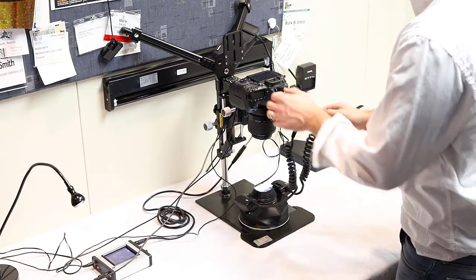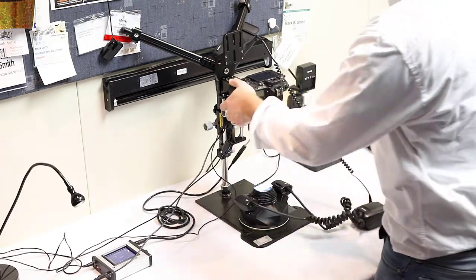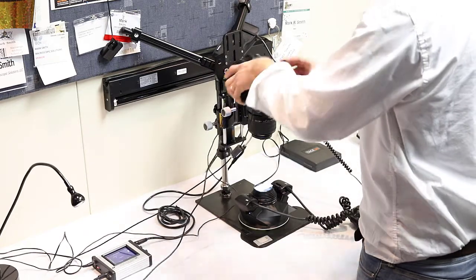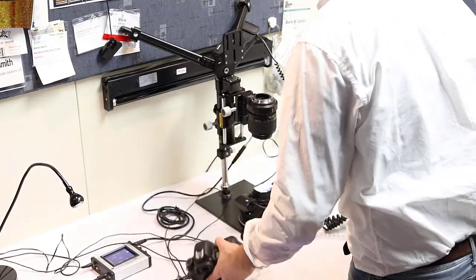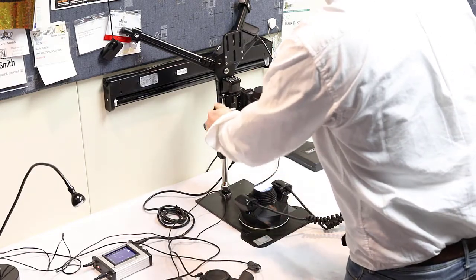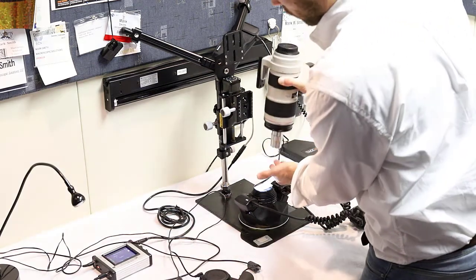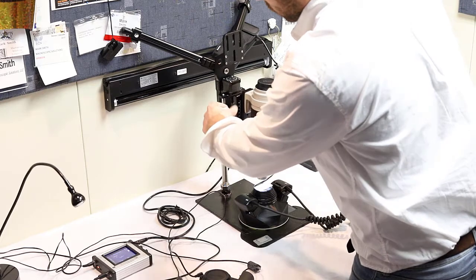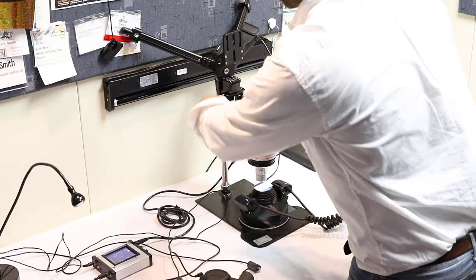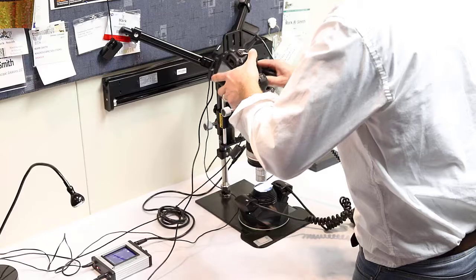Okay. So what we're going to do quickly is just show you how to switch this out. So first thing, turn the camera off. You want to disconnect the flash and set it to the side. You're going to take off your camera body. Again, be very quick. You want to use your dust caps. So we're just going to cap the camera body, cap the back of the MPE65, disconnect the MPE65, set that to the side. We're going to replace it. You want to make sure you're aware of your working distance down here, so you don't accidentally risk cracking the glass. Make sure you have two hands. Tighten it down. Remove the back of your dust cap. Add your camera body.